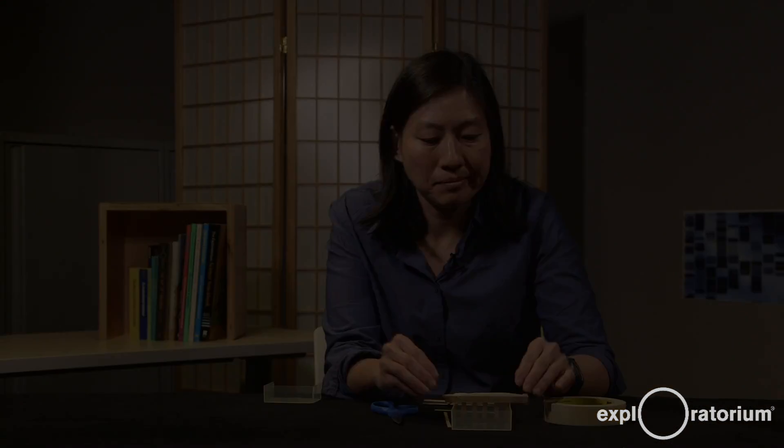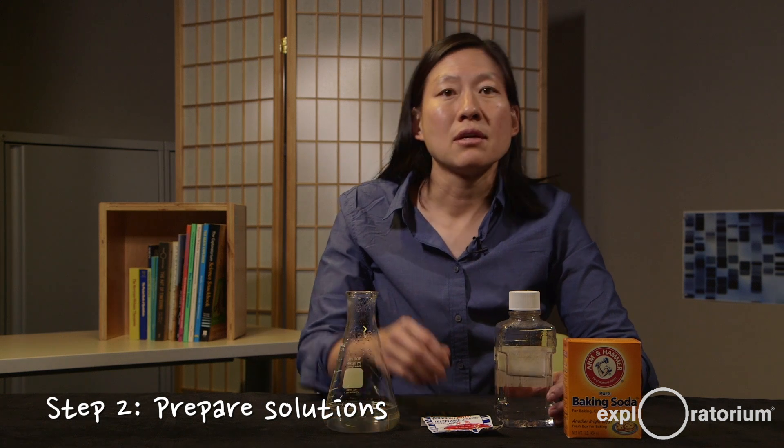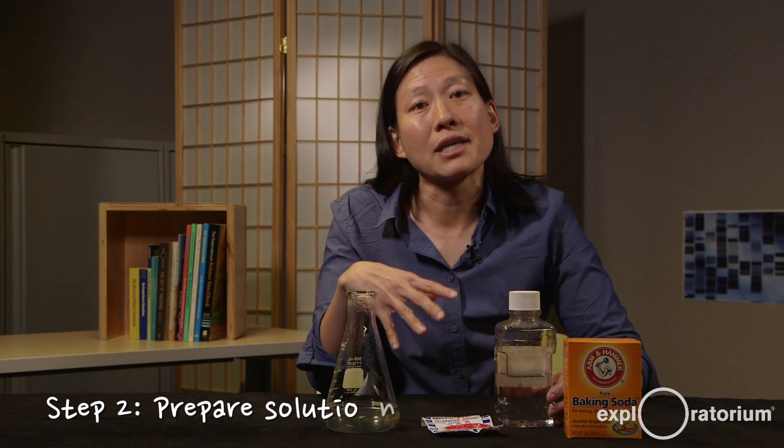I have one here that I've made before where you can see five teeth wedged in between two popsicle sticks. This is going to sit nicely inside my box with a small gap between the bottom of the teeth and the bottom of the box. Now I'm ready to get my gel together. The next thing you want to do is prepare the solutions — the gel and the electrolyte solution — for the things going inside your chamber.